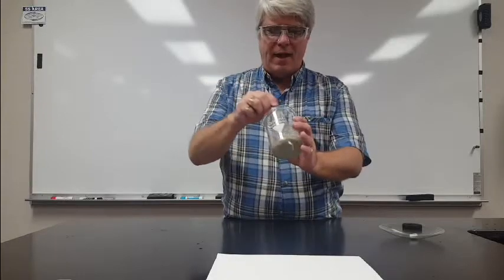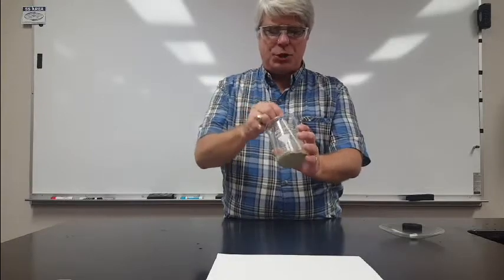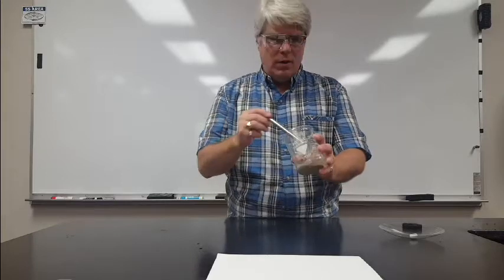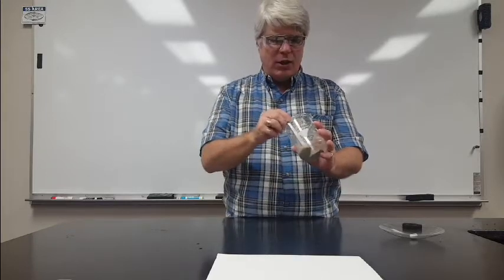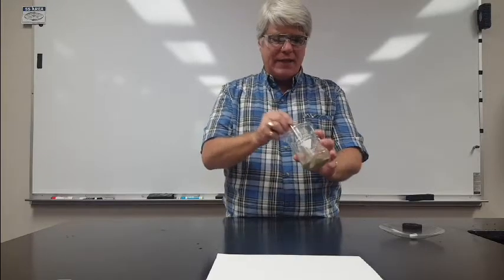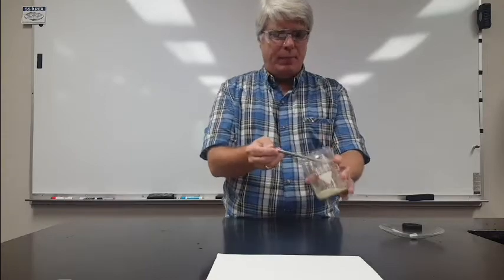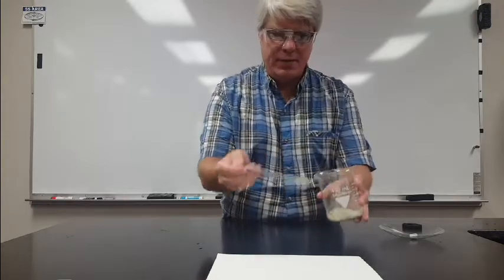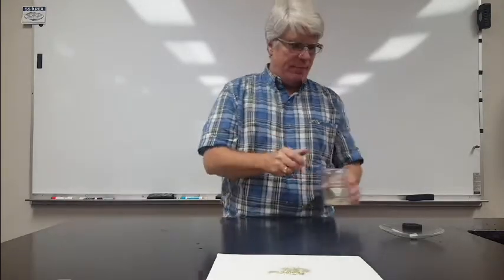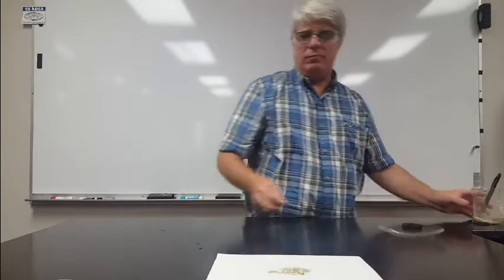In this beaker, I've got a mixture of iron and sulfur. Sulfur is a yellow solid, iron is a black solid, and this is just a mixture of the two. I'm going to put some out on this white paper there. And you can see it's a dirty yellow, because it's a mixture of iron, which is black, and sulfur, which is yellow.